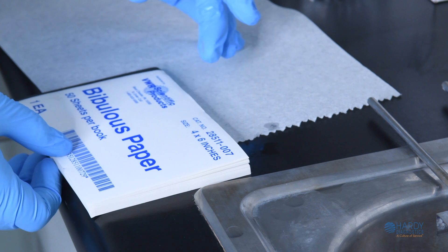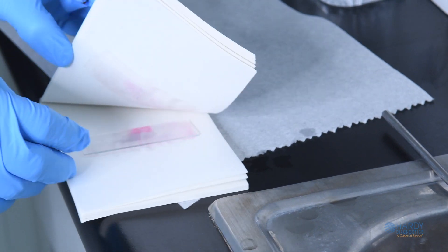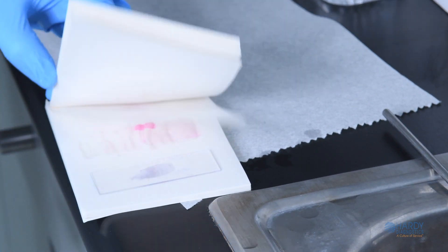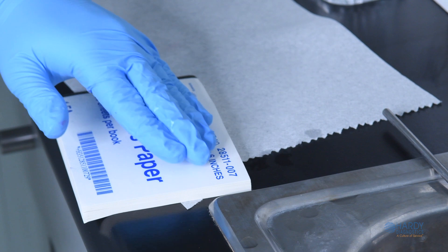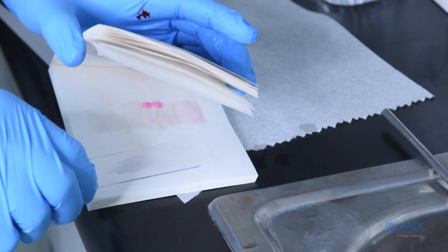Alternatively, gently dry the slide by blotting it using lint-free bibulous paper. Do not use a wiping motion, as this can remove the smear.